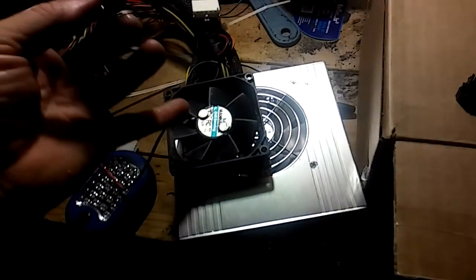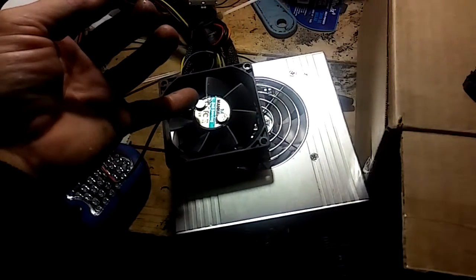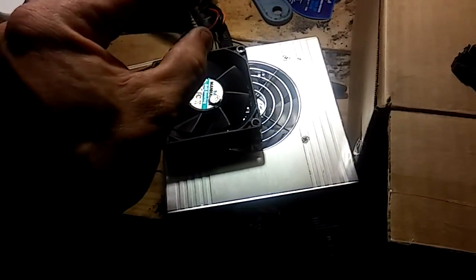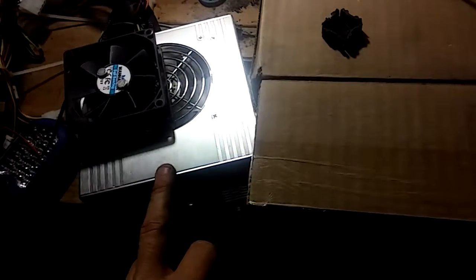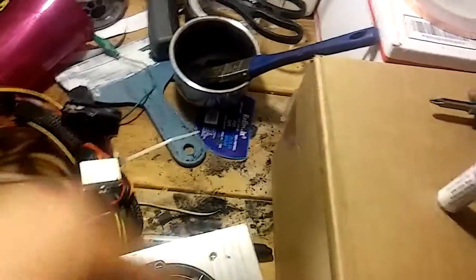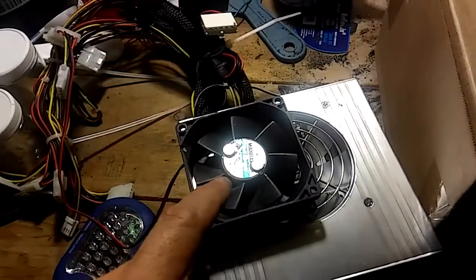It was a little difficult to get them to balance and match up. I'm gonna wrap the rest of the stack up really good in some plastic. They're set so that one is north on top and one is south on top, so they'll spin the stir bar inside the jar. I've got a power supply with a jumper in the right spot so it just turns on with the switch, but I won't turn it on right now because I'm waiting for the glue to dry.